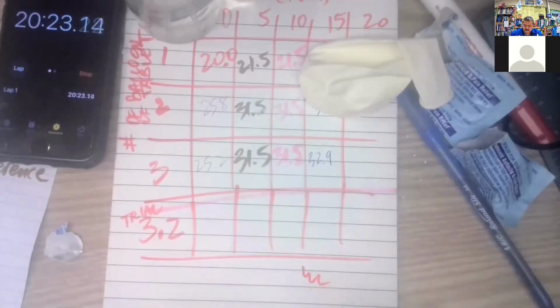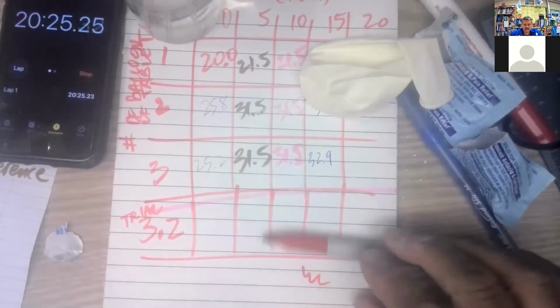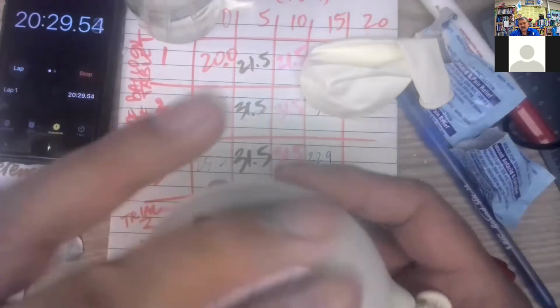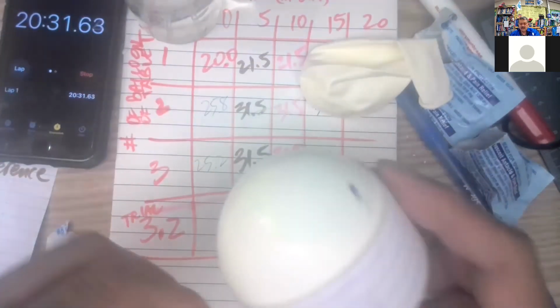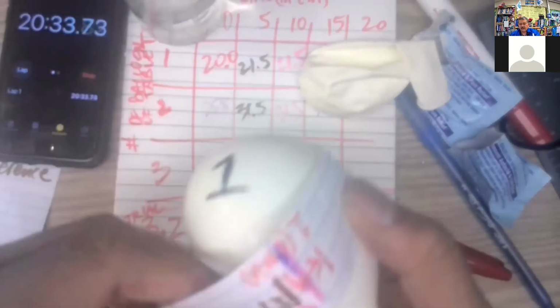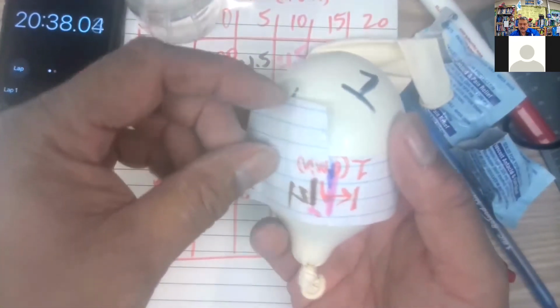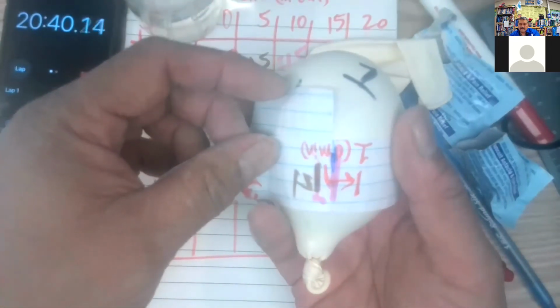Let's see. Does that look different? Okay, let's do it. Because it doesn't matter what color it is. I just lost 30 seconds. So is it going to change them? Same. Look at that. Same as the pink one, which was a 10-minute number.